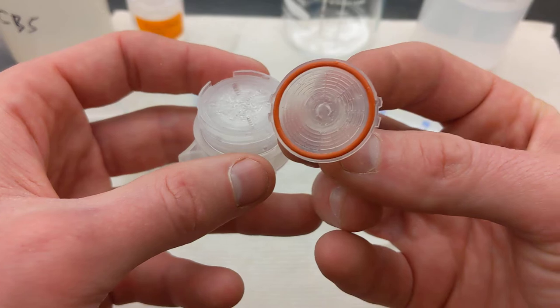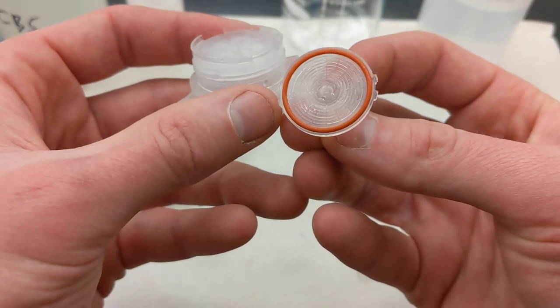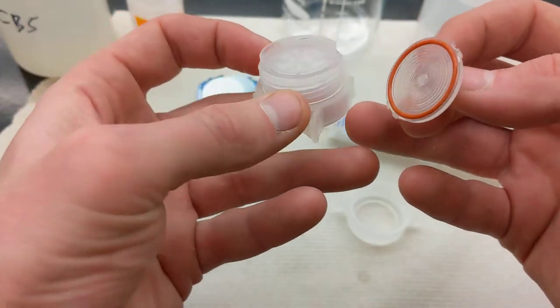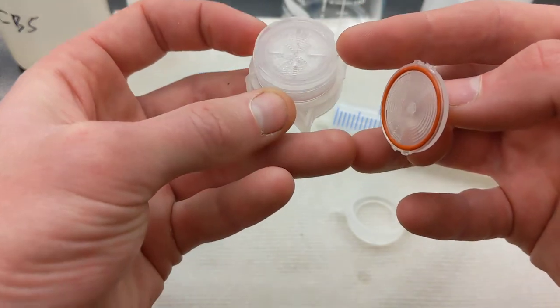And then this piece, you can see there are these keyed sections on either side that match the notches on the base here.